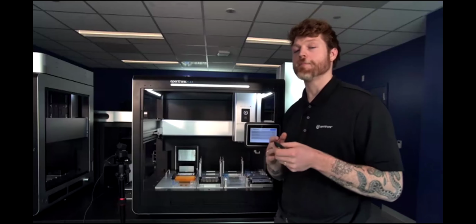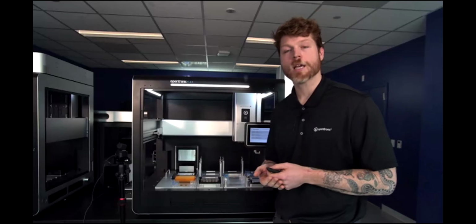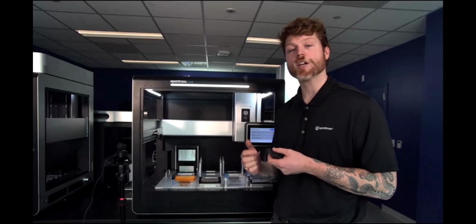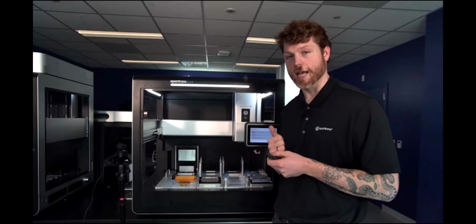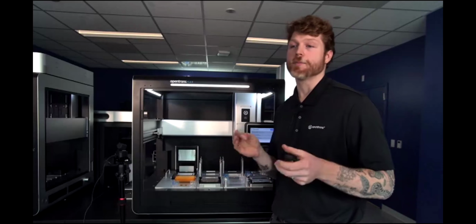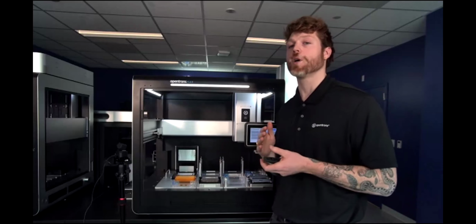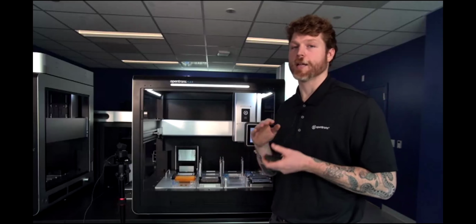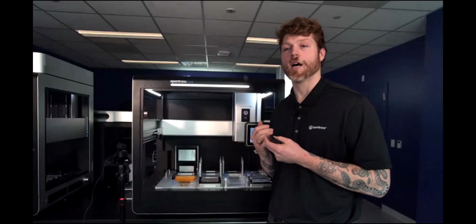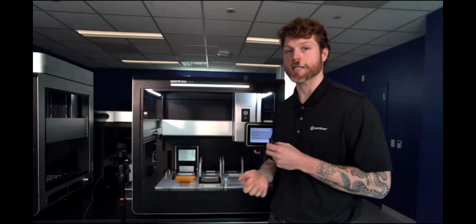So if you wanted to add just tip racks, you can add 28 more to your protocol across 4 stackers. In terms of PCR plates, because of how they nest into each other, you can actually add up to 48 more PCR plates to the protocol. And depending on deep well, you're somewhere in the 16 to 20 range, depending on how they stack into each other for the ability to have them exist within the stacker space.